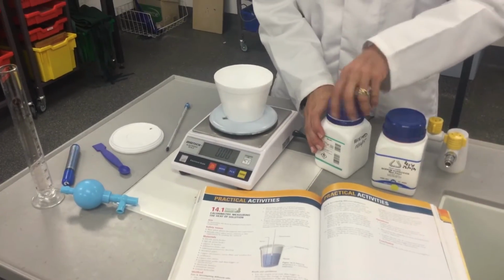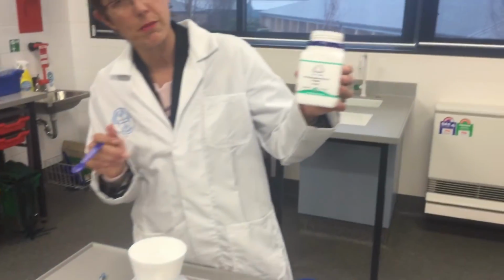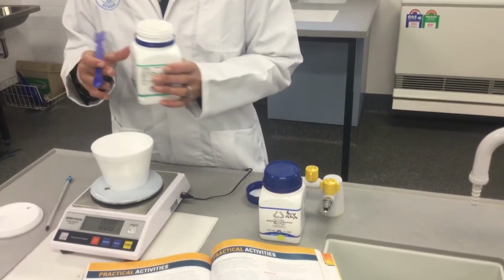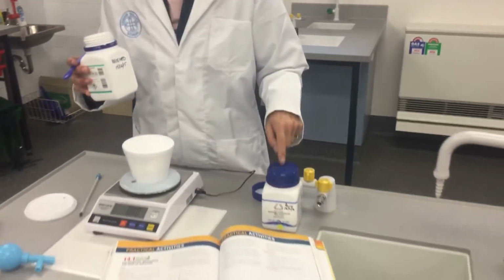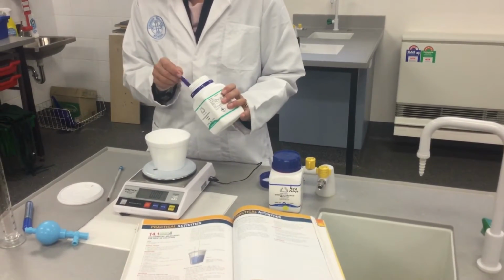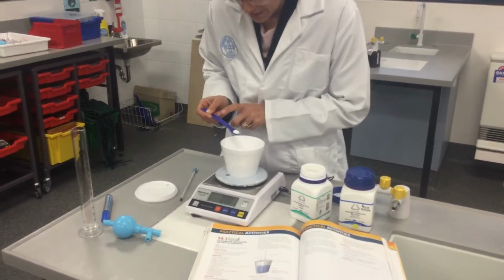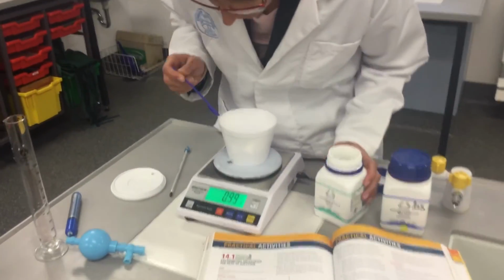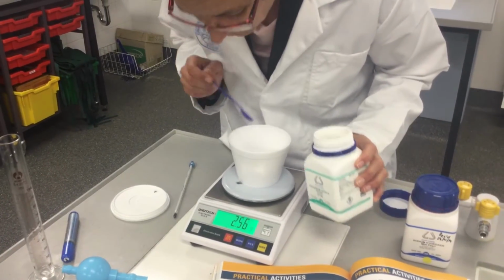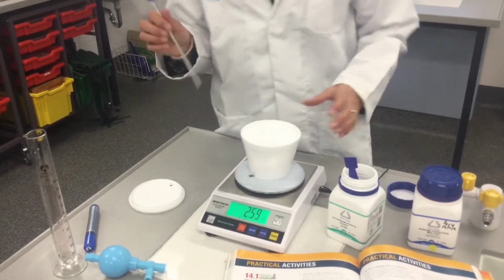What you then want to do is put the whole apparatus on the weigh balance, and weigh about 2 grams of salt. In this case, I'm going to start with potassium nitrate. The other one we're going to do is sodium hydroxide, and we need to be really careful with that because it is really, really nasty. It's caustic, it will burn you, and it's solid, so we want to be very careful with that. So I'm going to add approximately 2 grams of solid. So I've got 2.60 grams.